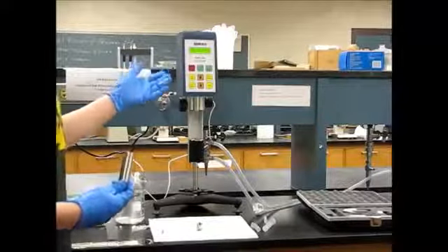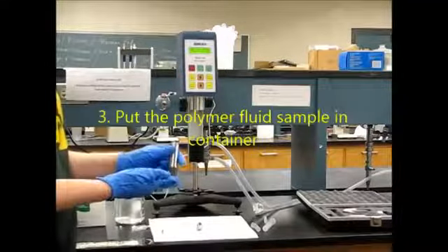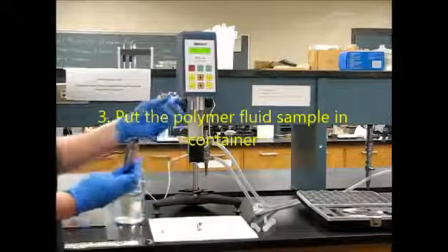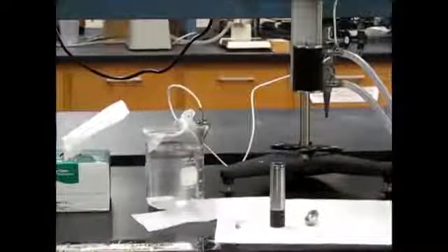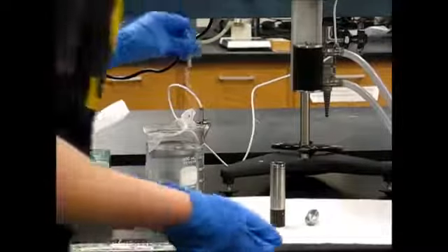Now it's telling us to replace the spindle. But before we can do that, we need to fill our sample container around 25% full with our polymer solution using this. It's going to take about 3 squeezes to get to 25%. Be careful because this fluid is very viscous and it will make a mess.